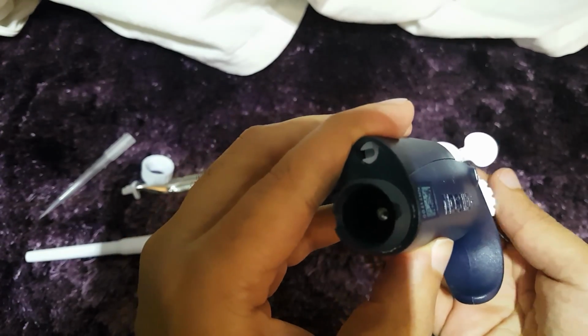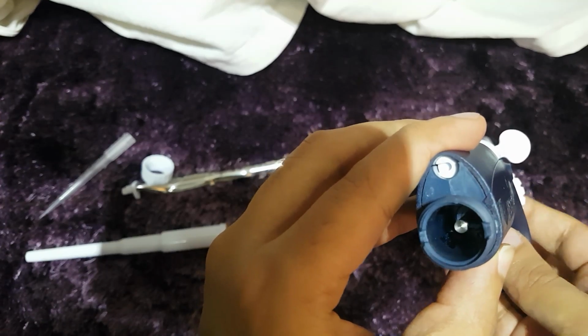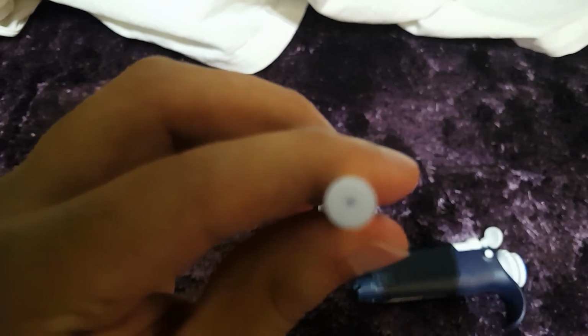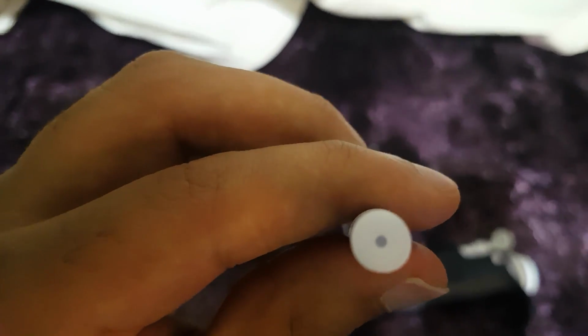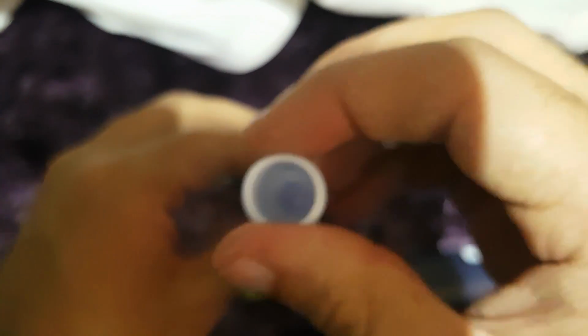This is simply what pushes it through, as you can see there. Not sure if you can see, there's something in there to push. So, we have a look in here. Do we maybe have a blockage in here? So, what you should be able to do is pass air through here. That's the way pipettes work. And I have a feeling that we have a blockage through this one.